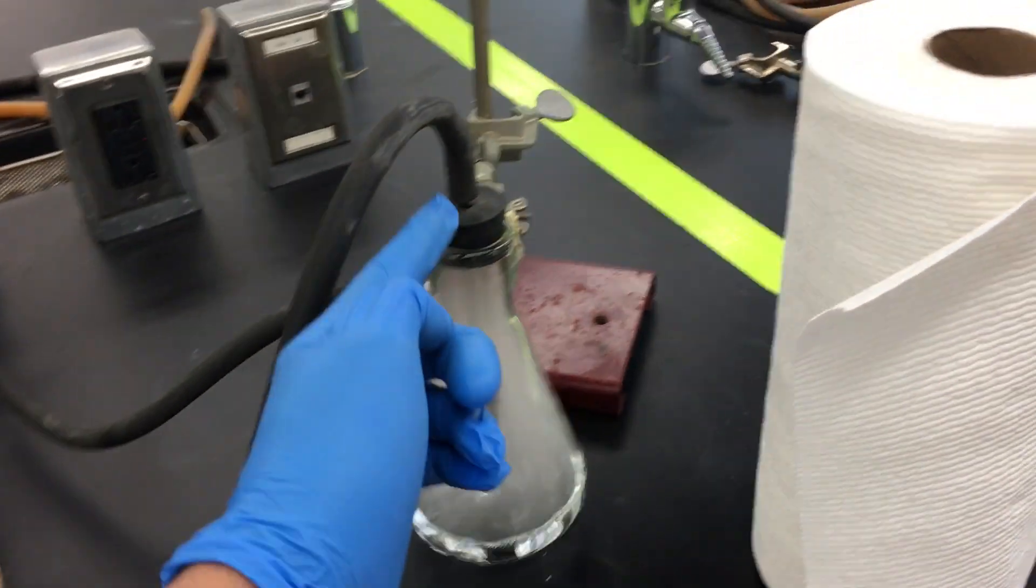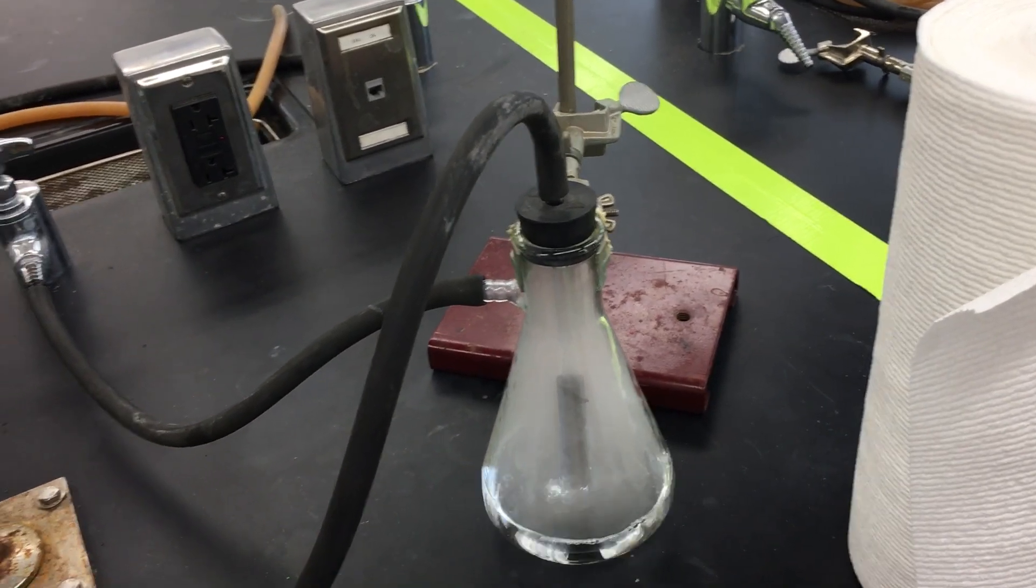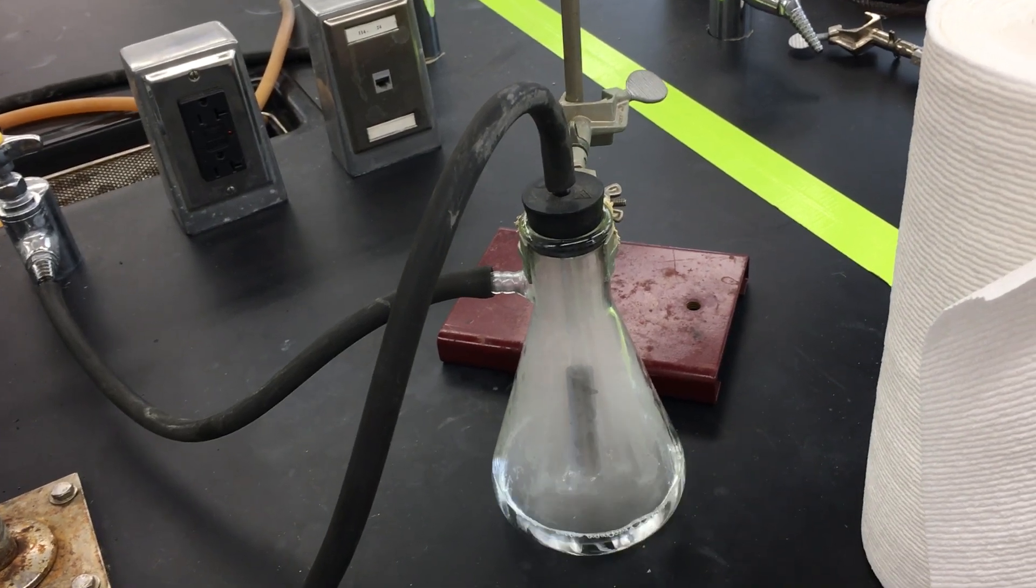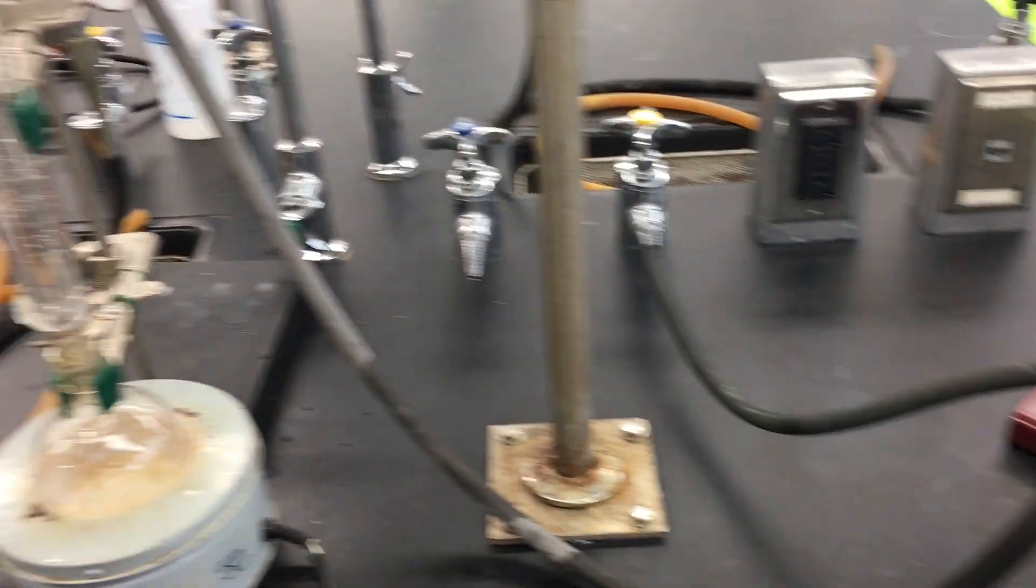Here we have our vacuum setup, the trap to collect any hydrogen bromide fumes and neutralize them by having them react with sodium hydroxide.